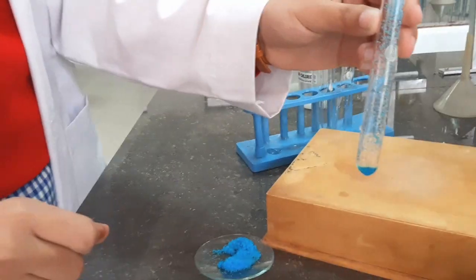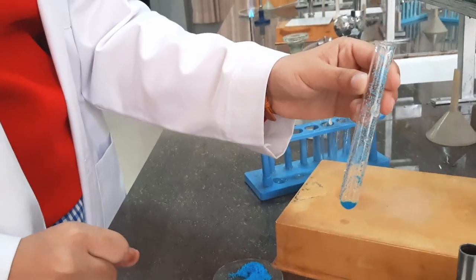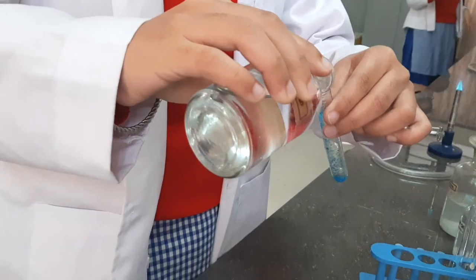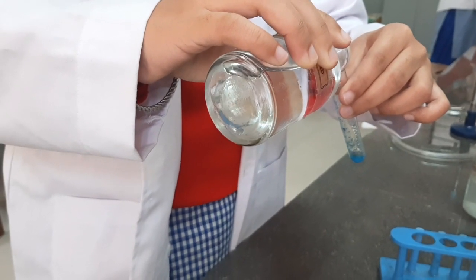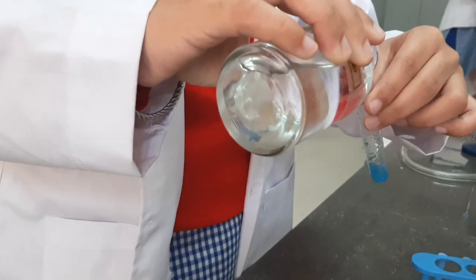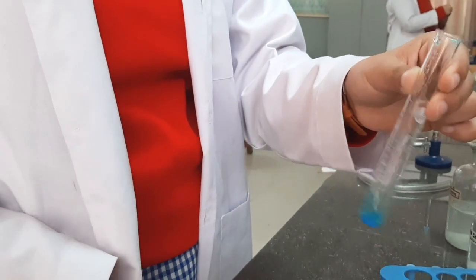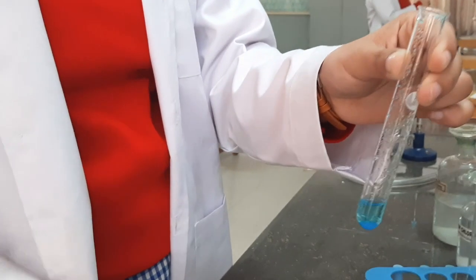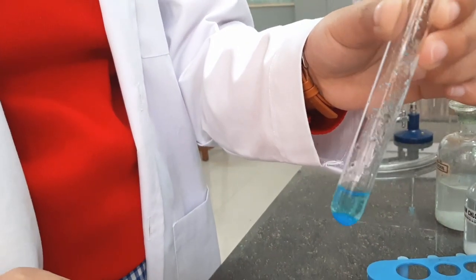This is a solid salt — very important to remember. To the solid salt we are going to add dilute sulfuric acid. Dilute sulfuric acid is added to the solid salt and no change is observed.